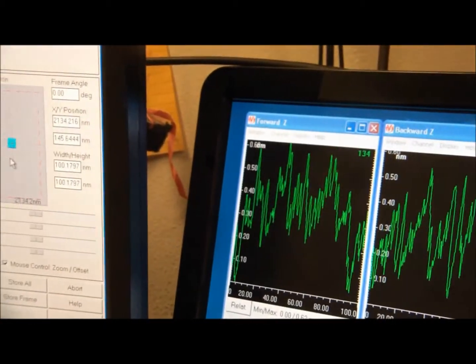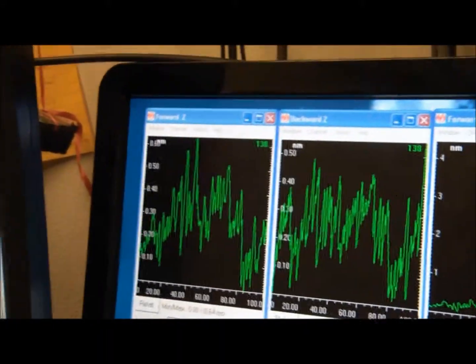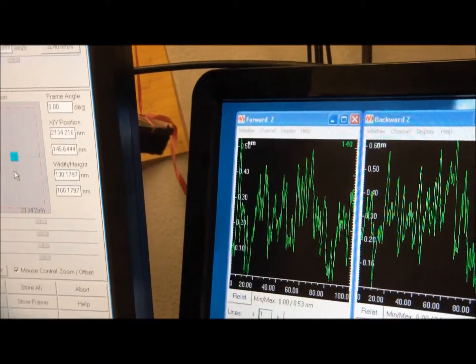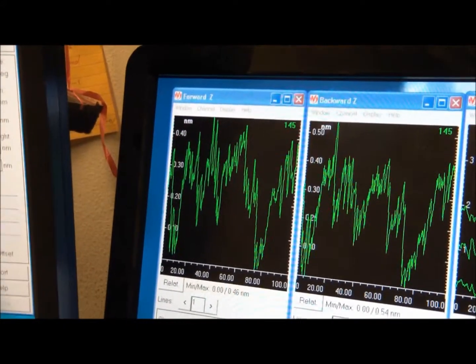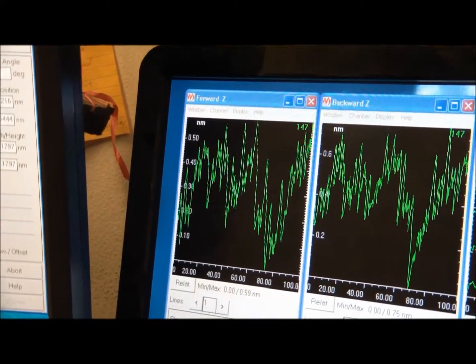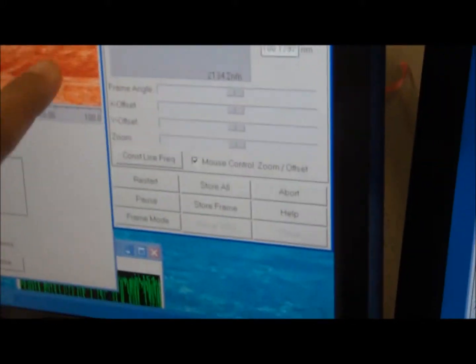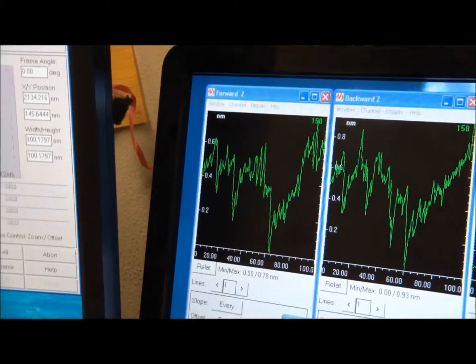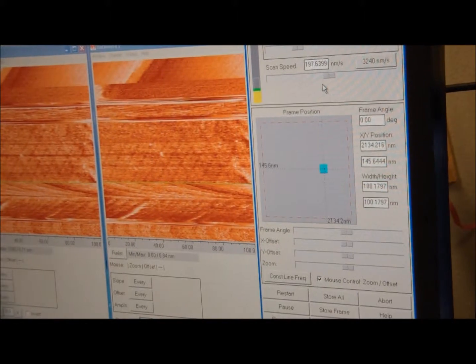It's kind of like inertia, where your tip wants to continue to move in that direction. It hasn't completely settled down yet, so you get drift in your images. Your images look slanted like that. As you can see, there's a slant right here. That's from the drift that we observed in this graph right here. It seemed to have settled down already, which is good. So you will get more straight lines from this.